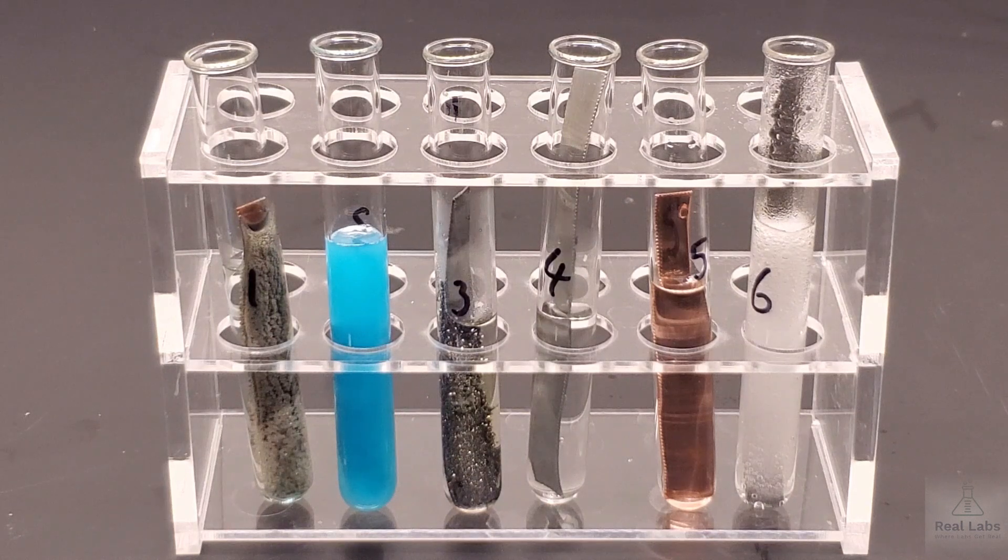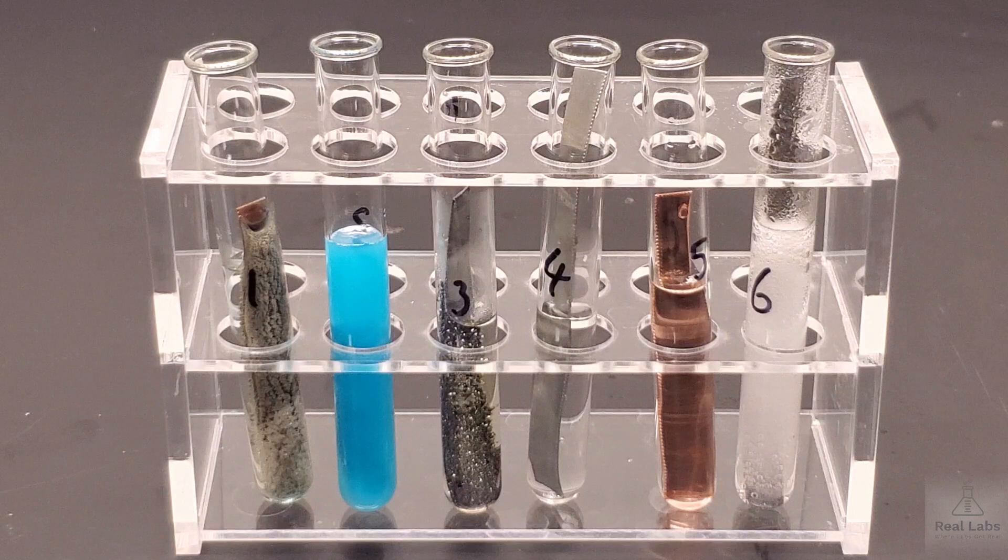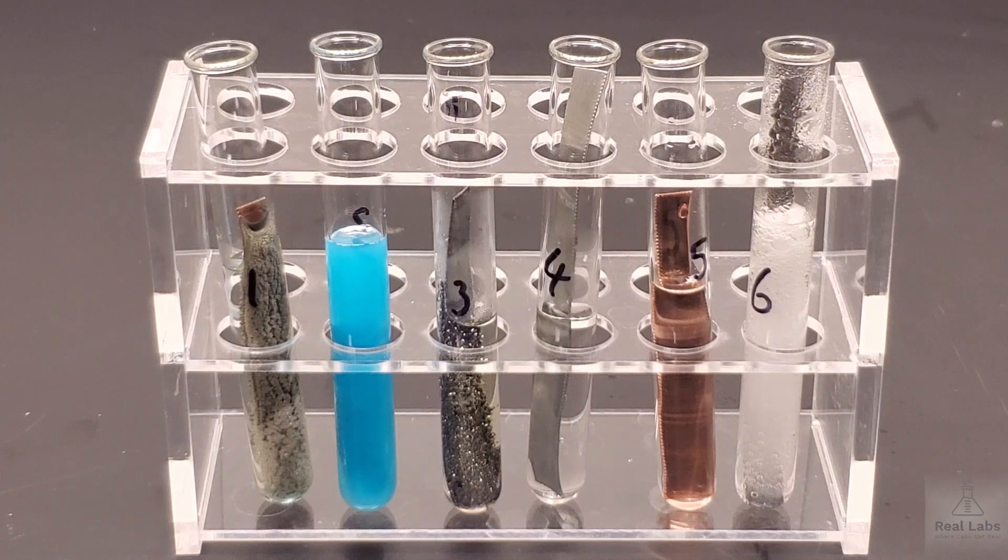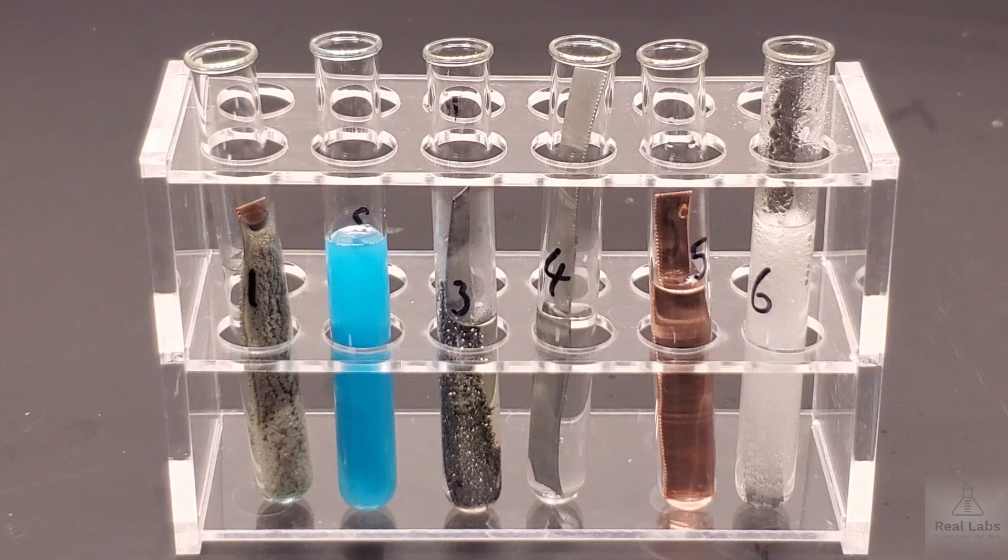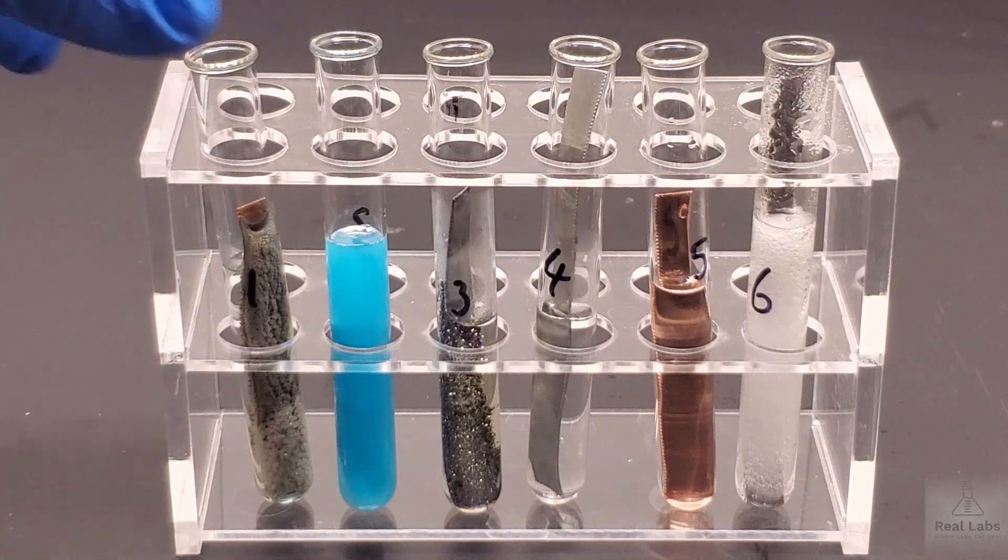Alright. So these have been sitting here now for about 10 minutes. You can probably see some significant changes in some of them, and maybe not so much in others. I'm not going to tell you exactly what to write or anything like that. What I want you to do is look at it and make your observations to what you see.